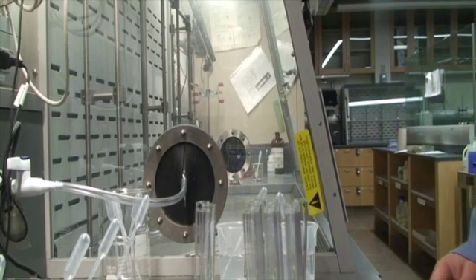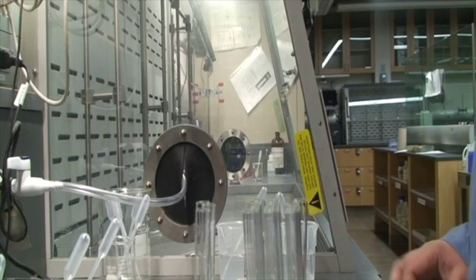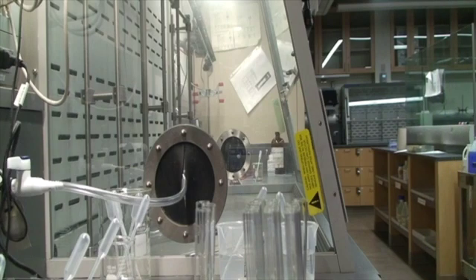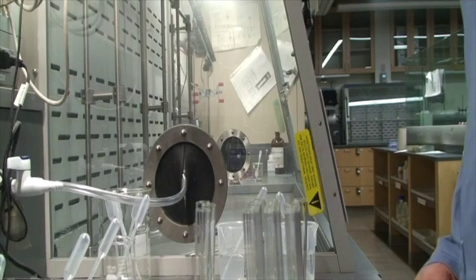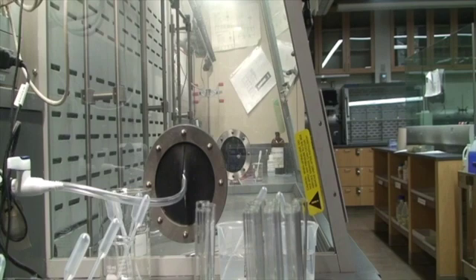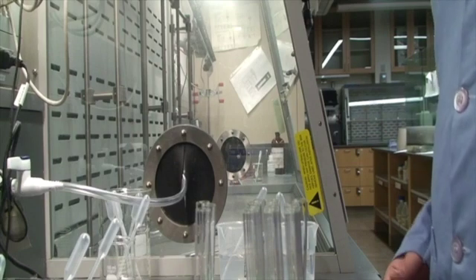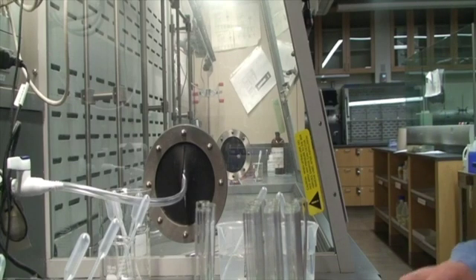We need to identify them, and we're going to do that by doing a few single displacement reactions. We're going to look for evidence of a chemical reaction. Some things to look for are evolution of heat, so I'll be feeling the test tube to see if it gets warm or even cold in some cases. We can look for a precipitate, the formation of a solid. We can look for bubbling, which is evidence that a gas is being formed. And in this experiment, we can also look for smell.